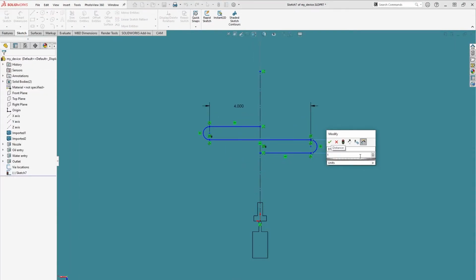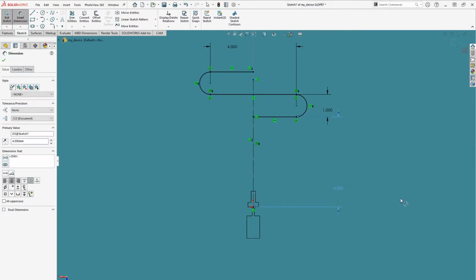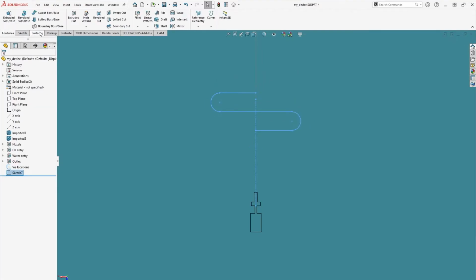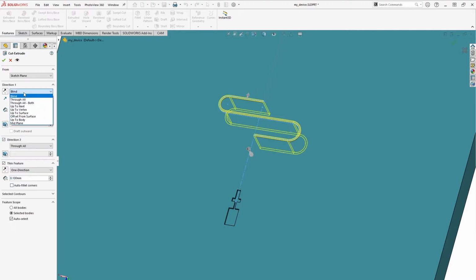Finally, a 4mm dimension between the lowest line and the origin. These sketched lines will serve as the center of our thin extrude feature. Exit the sketch and click Extruded Cut, and select the thin feature box. Set direction 1 as up to surface and select the bottom of our previously formed channels, and deselect direction 2.